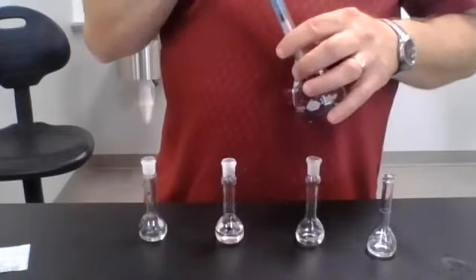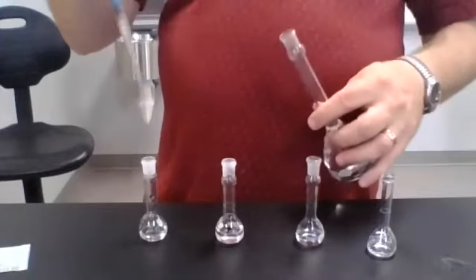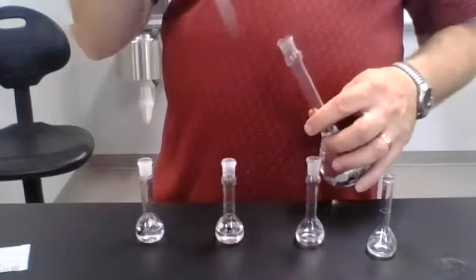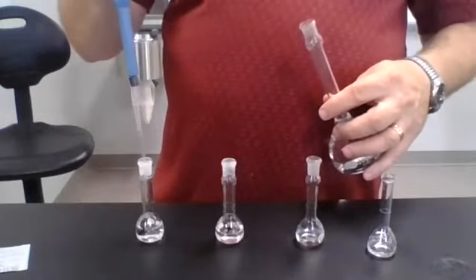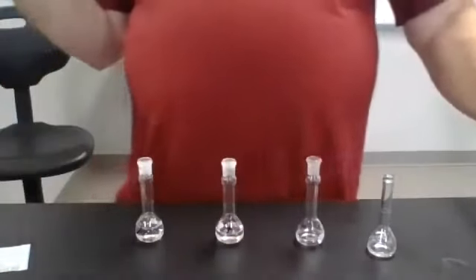1, 2, 3, 4, 5. Okay. I now have my solutions.